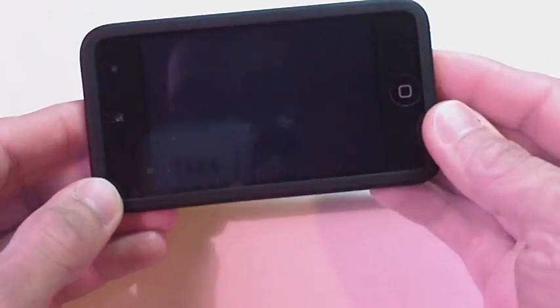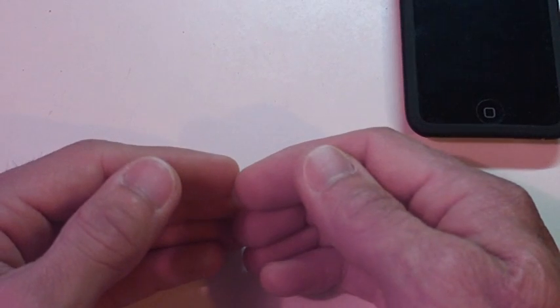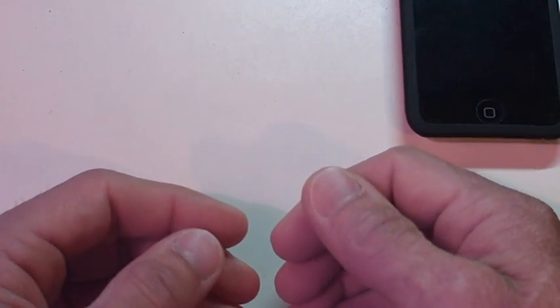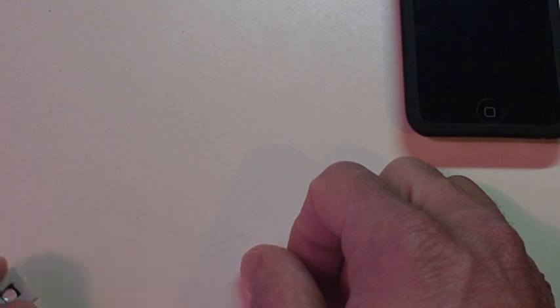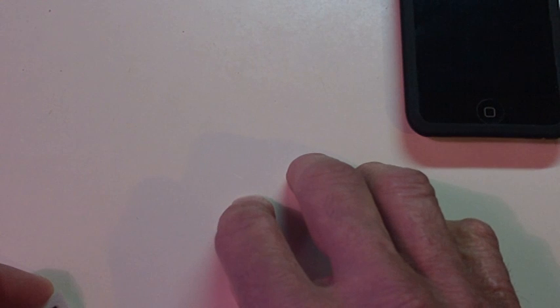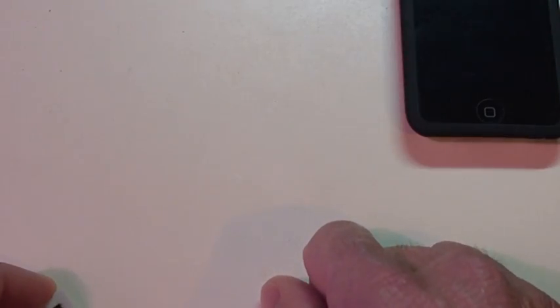First of all, you want to take your iPod Touch and put it on the side, since you don't need it right now. In this case, you go find a DVD burner or a CD burner. Open up the case, see what's going on inside. Inside you're going to find, of course, the laser beam. The laser by itself, you can just save it, since it's a really powerful laser. Use it for laser pointing.